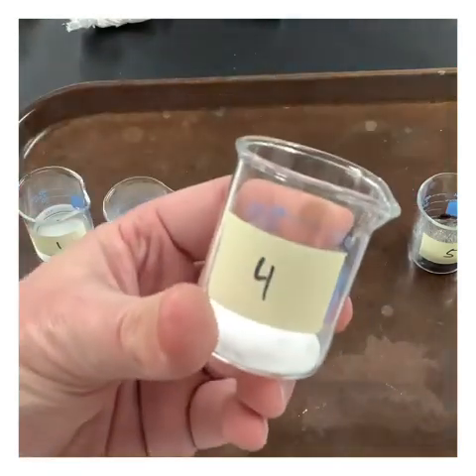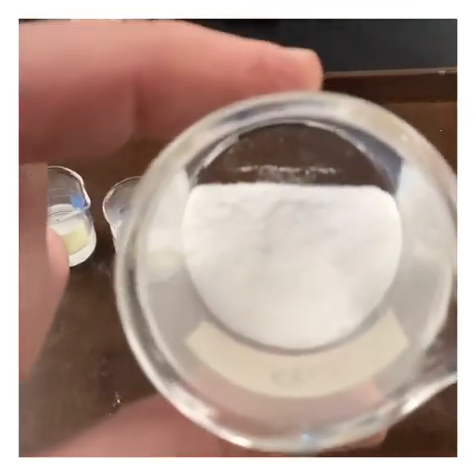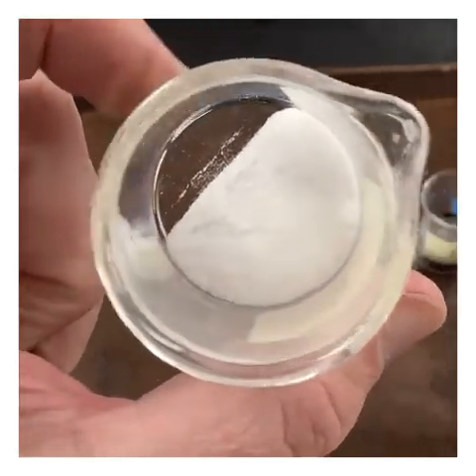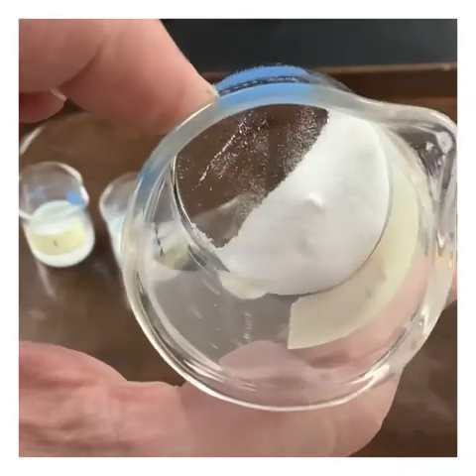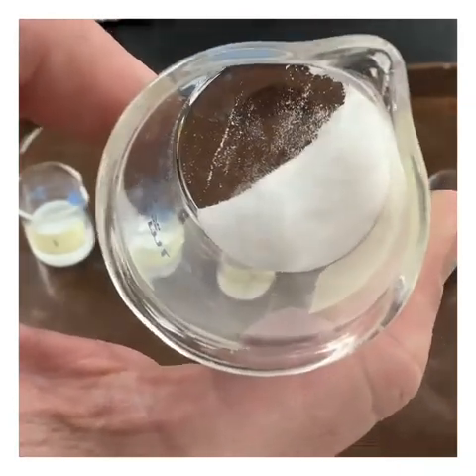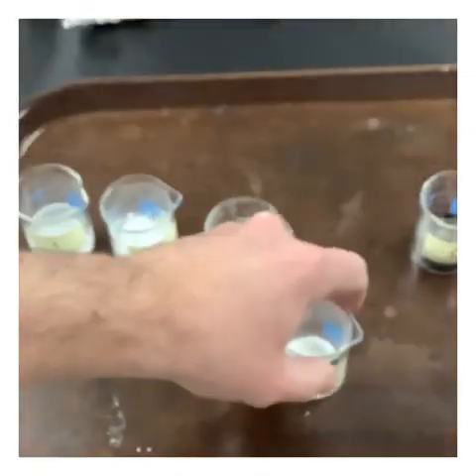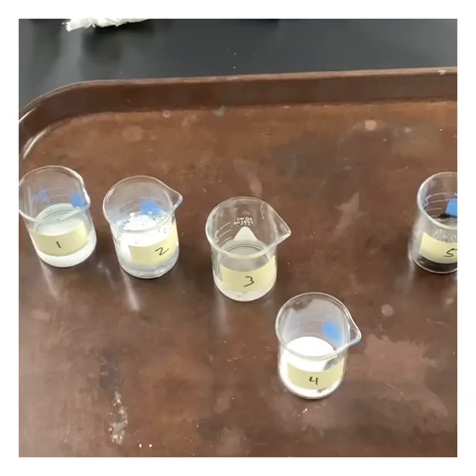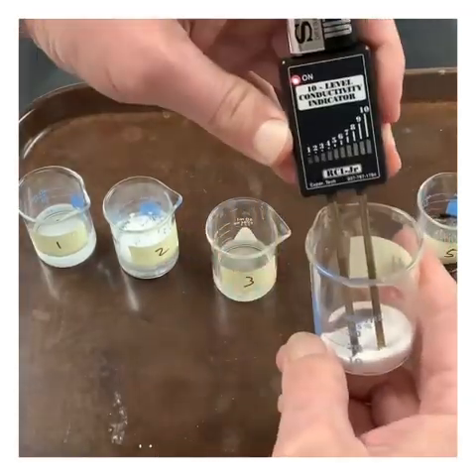Get to number 4. See if we can focus in here. Try the conductivity as a solid.